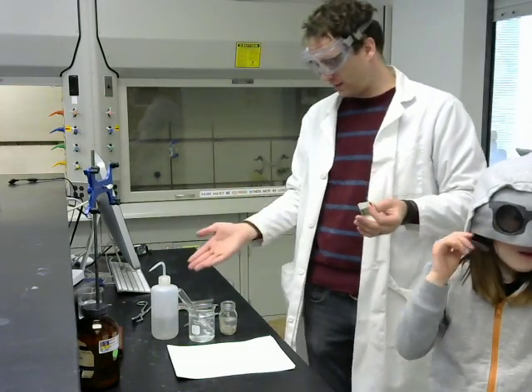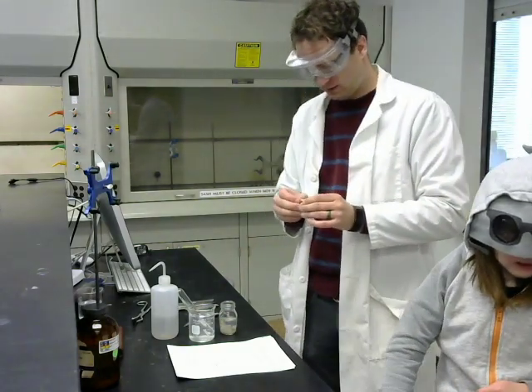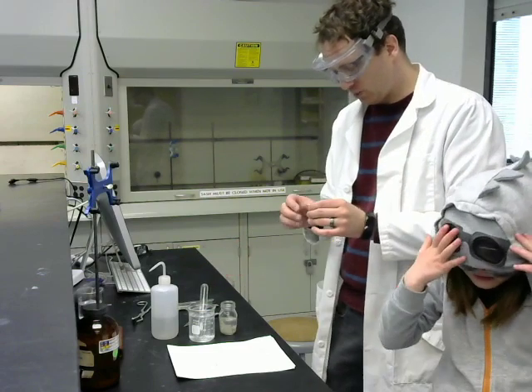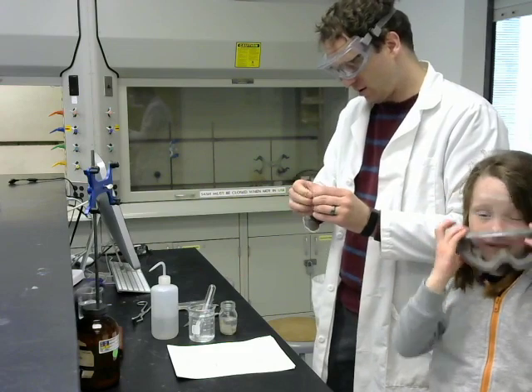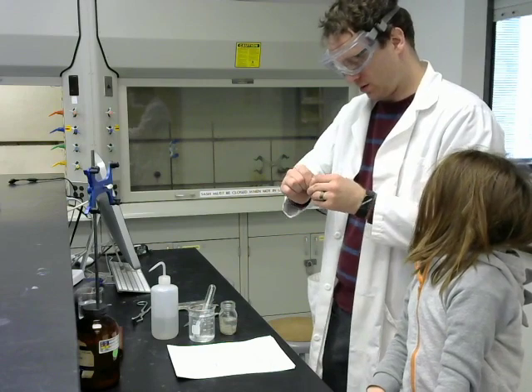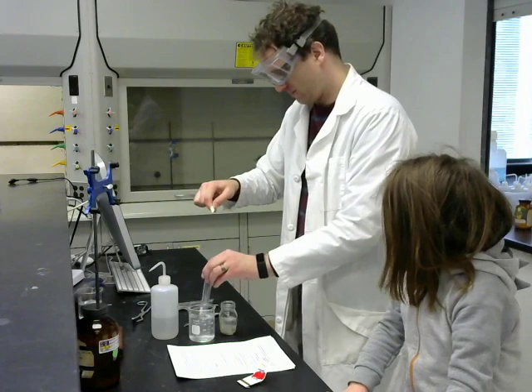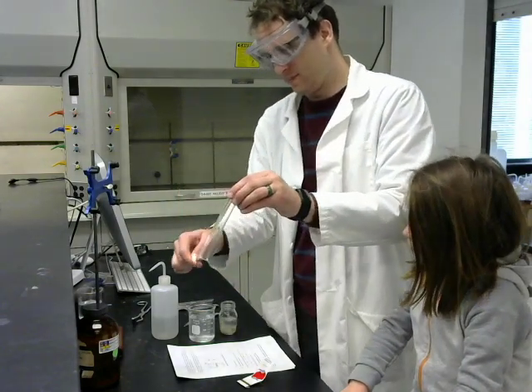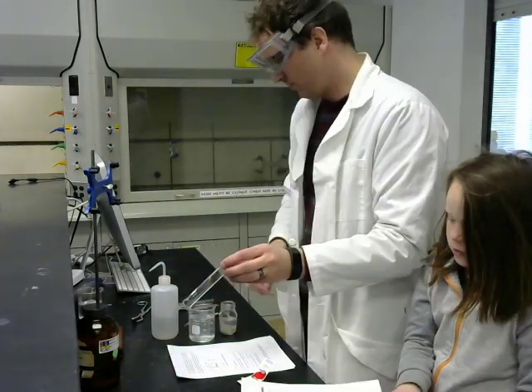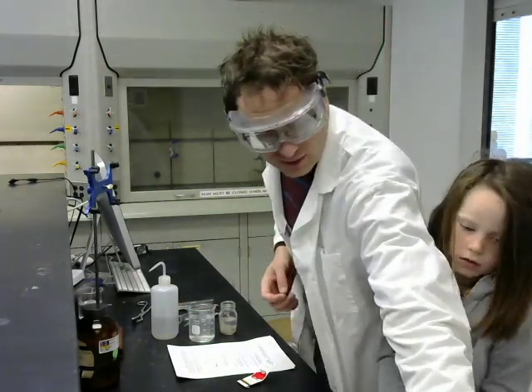So we're going to do two tests on the reaction products here. The first is to test the gas that we collected in the test tube. We want to see if it's flammable gas. So I'm going to light a match. It's a green match, isn't it? That's weird. There we go. Okay. Oh, it stinks in here. Hopefully you saw that little pop. That tells me that the product of that reaction was flammable.